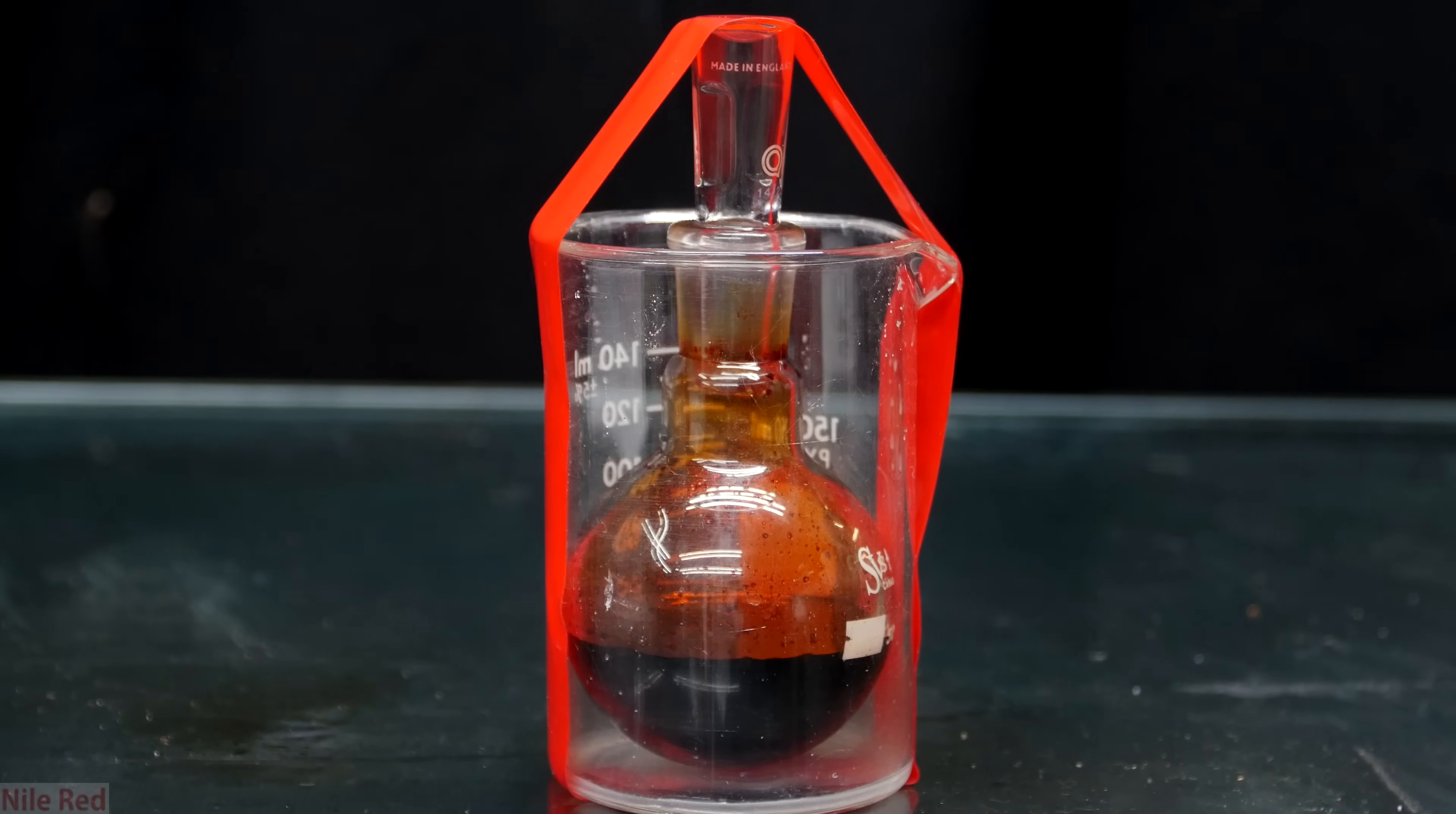I made a very sophisticated temporary storage container for this bromine. I planned to use it very shortly after making it so there was no use in ampouling it. For long term storage though, the best thing to do is to put it into ampoules like I did in my previous video. Anyway, that's all I have to say for now. Like I said in the introduction, I will be doing an element series for bromine at some point but I'm not sure when that will be.